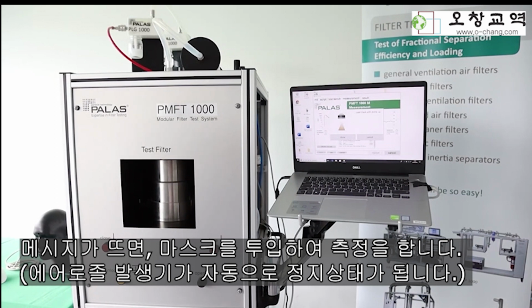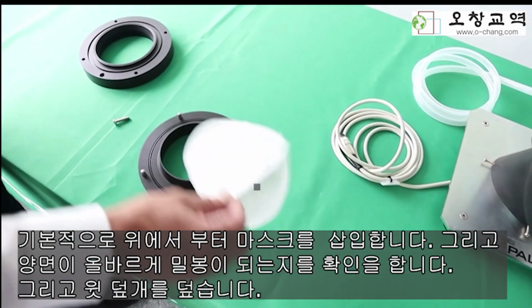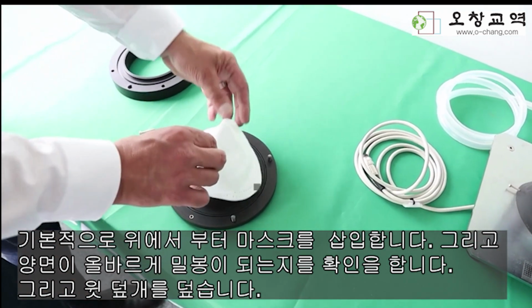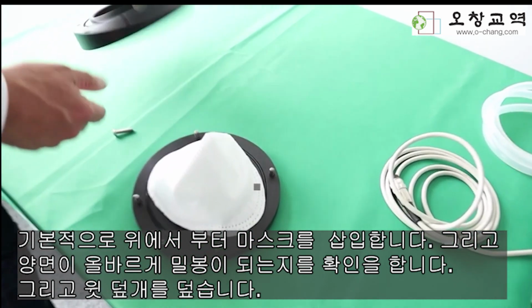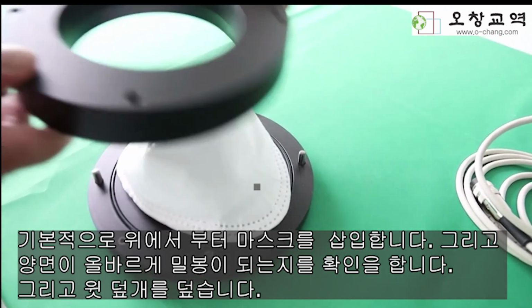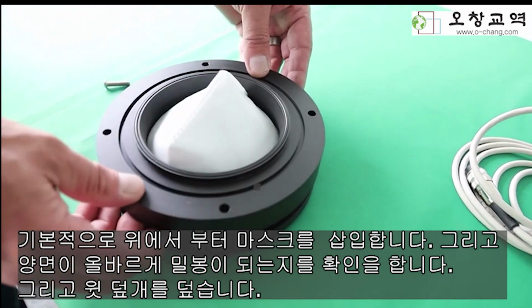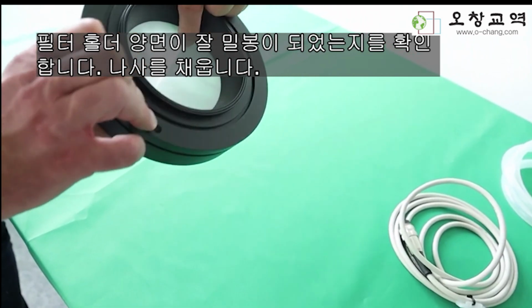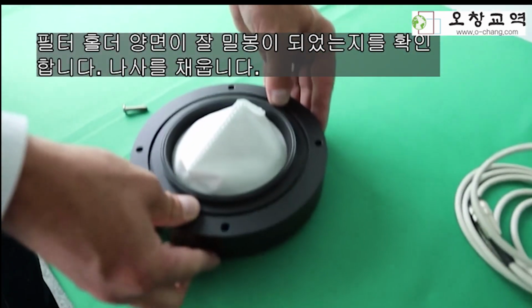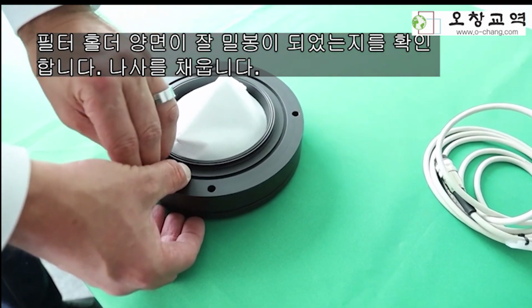See here, those mask with dome up. If not already done, you insert the mask now. Here is the basis for the filter holder. Insert the mask on top and make sure that both sides will be later on sealed correctly. Then press it down with the hand, and check as well from below that the mask is fitting correctly to the holder. Afterwards, secure the whole thing with the screw screwed in.